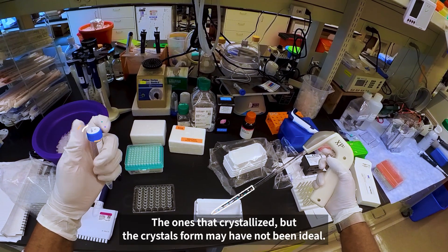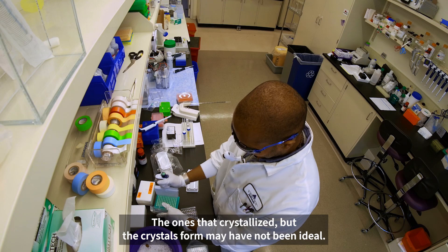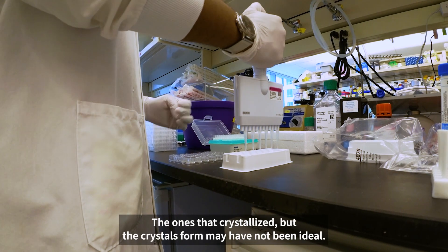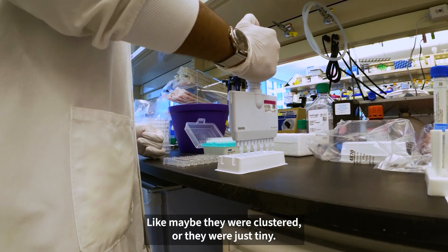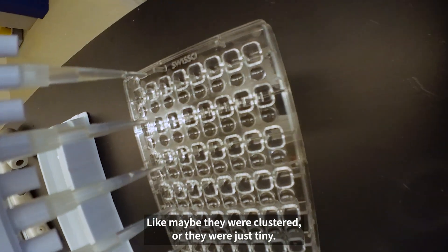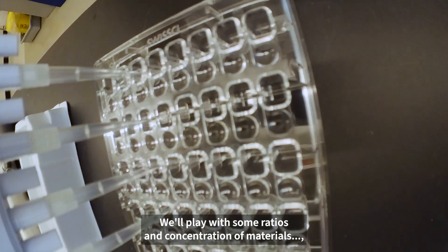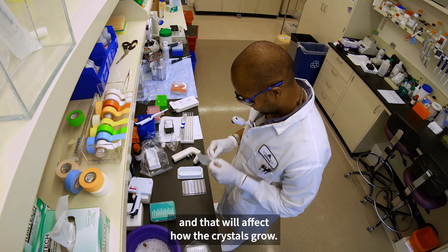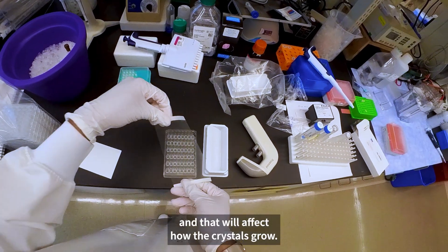The ones that crystallized but whose crystal form may not have been ideal — maybe they were clustered or just tiny. We'll play with some ratios and concentration of materials, and that will affect how the crystals grow.